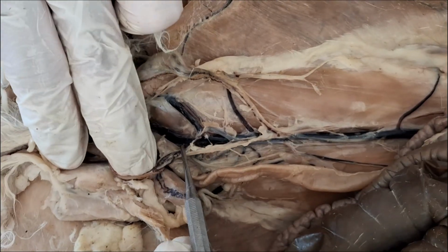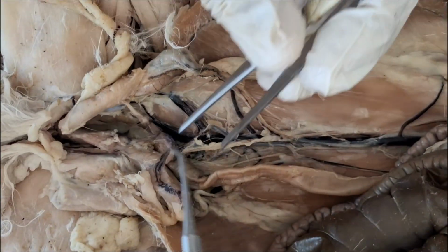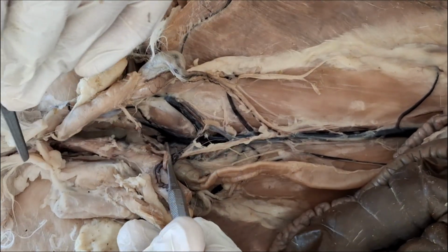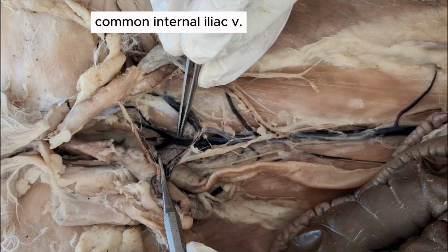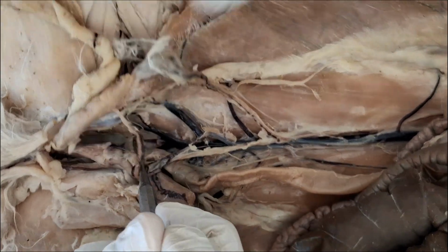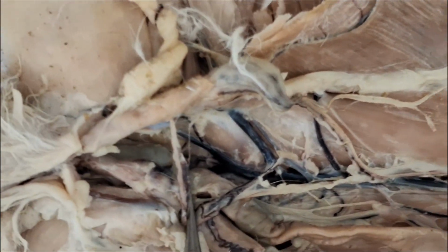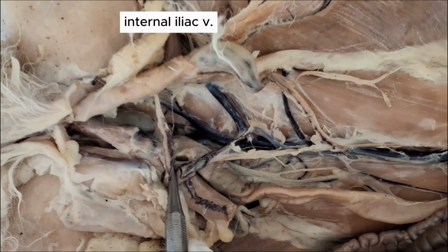And then the postcava continues downward as the common internal iliac vein. And then it splits again to give rise to the internal iliac veins.